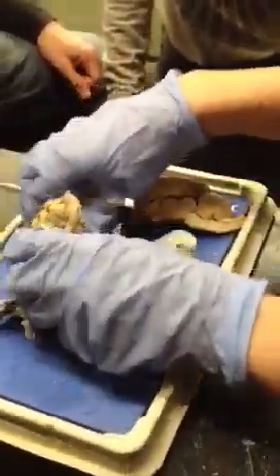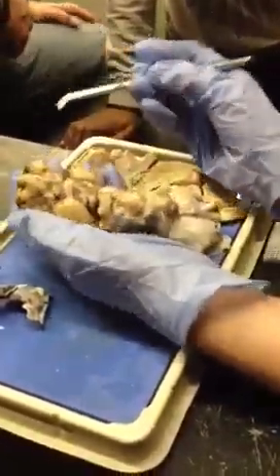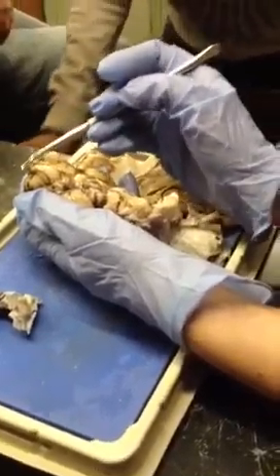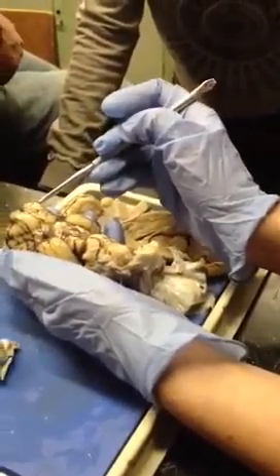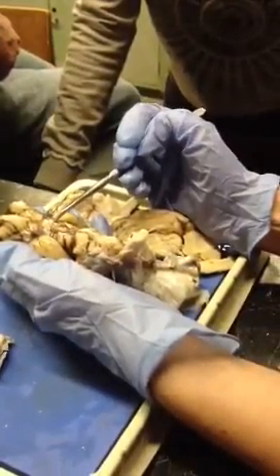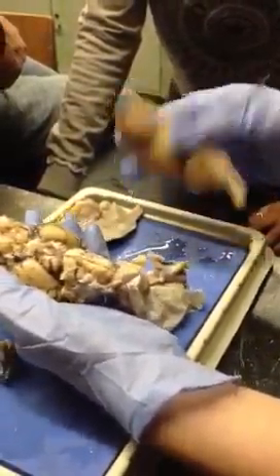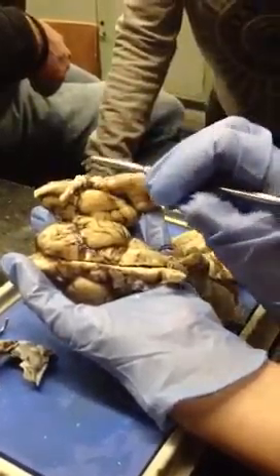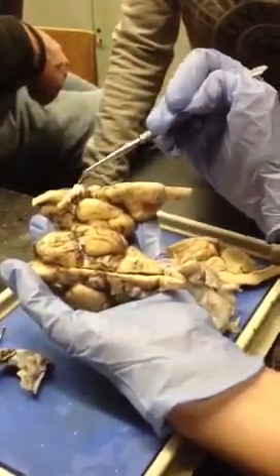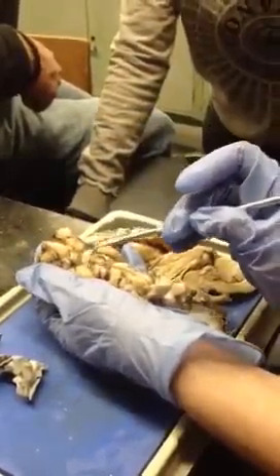Let's start by looking at inferior. Okay, so olfactory bulb. Here's one, here's the other. Then this would be the optic chiasm, but it's ripped off. There's one in a little bit better shape here. See how you can see the optic nerve? And then they make an X. That's the optic chiasm. So that would be here.